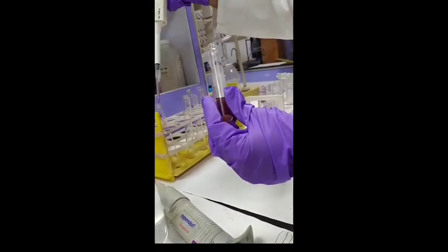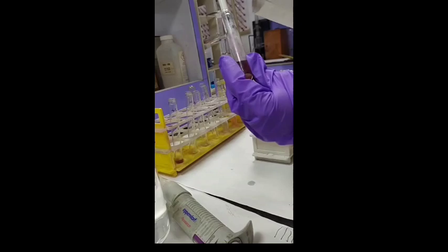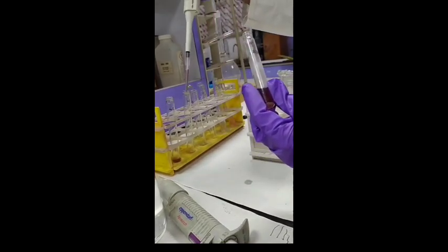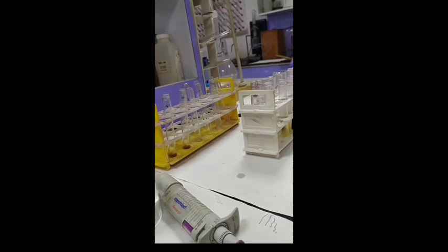Once the loaded sample is centrifuged, we extract the supernatant liquid with the help of micropipette and put 1 ml of each in 2 test tubes. And for the blank, we are going to use distilled water by taking 1 ml each in 2 separate test tubes.